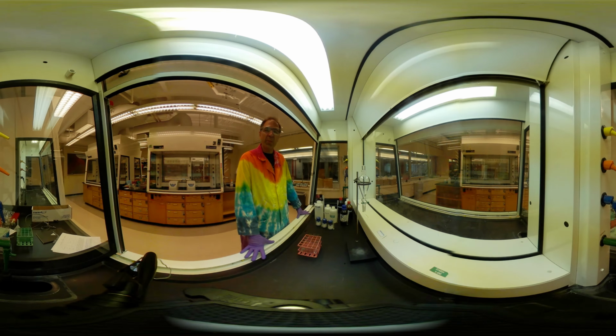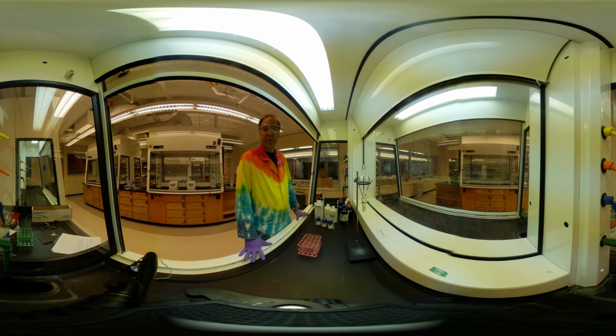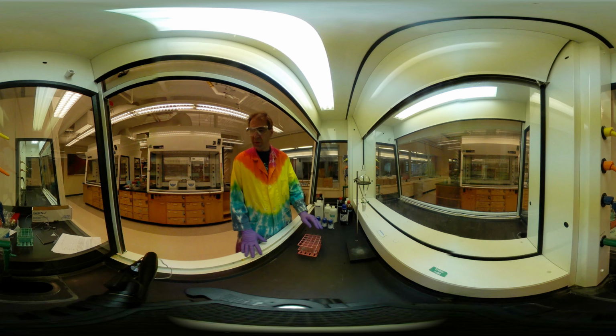Okay, here in the next part of the experiment, we want to look at several different compounds and their solubilities in different materials. Because remember, that's the whole point, to be able to use the difference in solubilities to separate things. So we have 3 different compounds that we're looking at here.